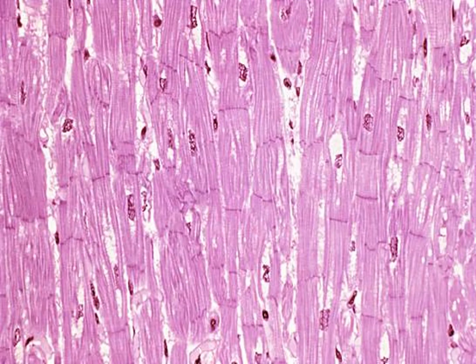And this picture is great because it shows us yet another unique feature of cardiac muscle tissue, and that is these specialized gap junctions here. They are called intercalated discs. Now, these intercalated discs are important because they allow for a nerve impulse to travel through quickly without having to go through the normal routine we will see later on that happens at a plasma membrane. So intercalated discs are gap junctions found uniquely in cardiac muscle tissue. So the function of cardiac muscle tissue is to contract the heart and pump blood through the heart. And of course, these contractions are involuntary.